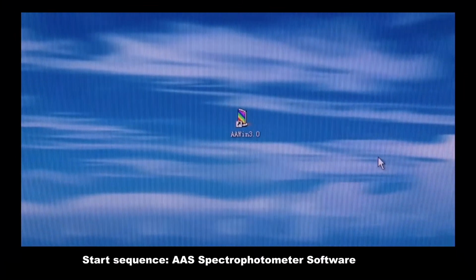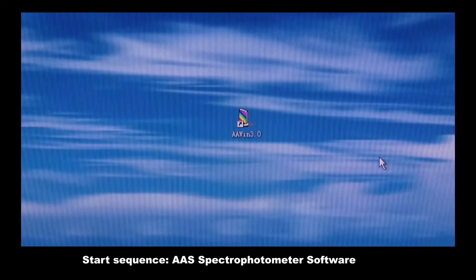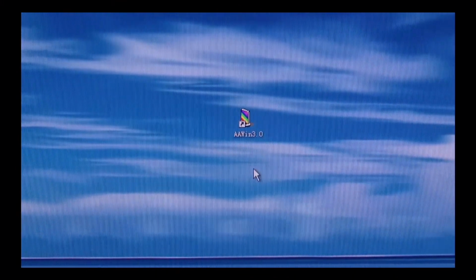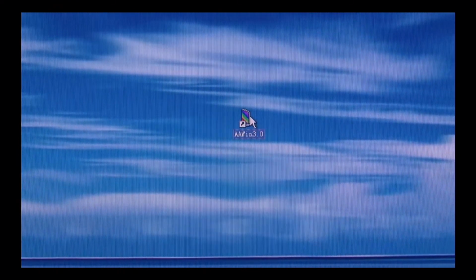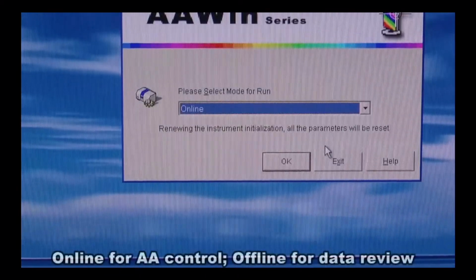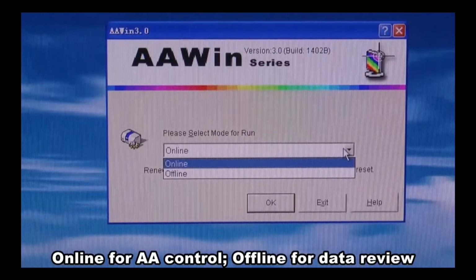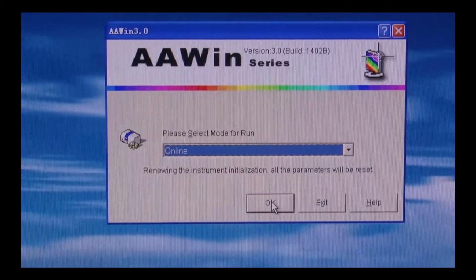To use the AAS software to control A500, please make sure to switch on the computer first and then power on A500. Please confirm that the number 1 position in the lamp turret has a lamp inside, and then double-click on AAS software. Press OK. Normally we choose online mode to run the system. In case you want to take the record or the data of the testing, you can choose offline mode. Now we choose online mode and press OK.